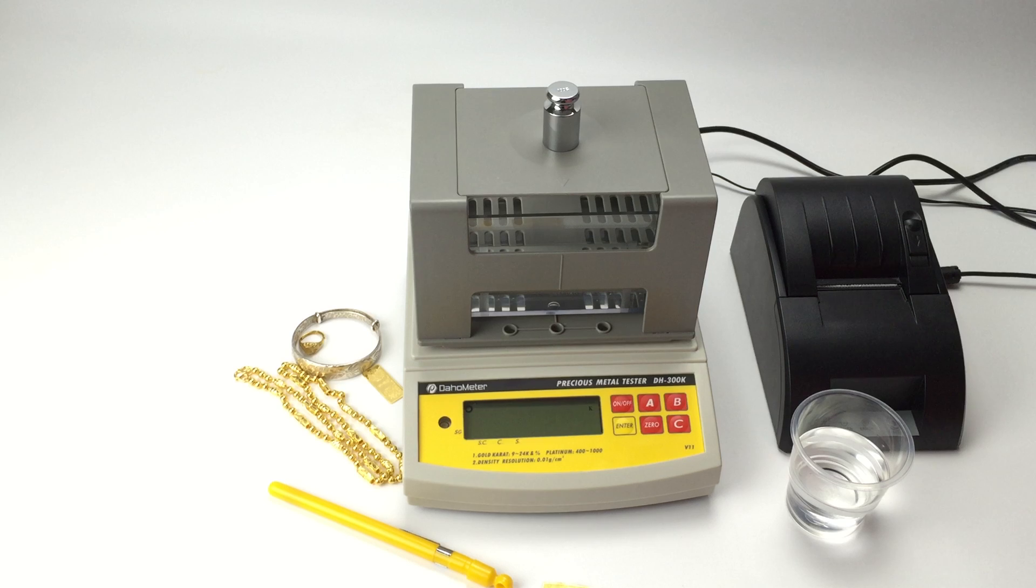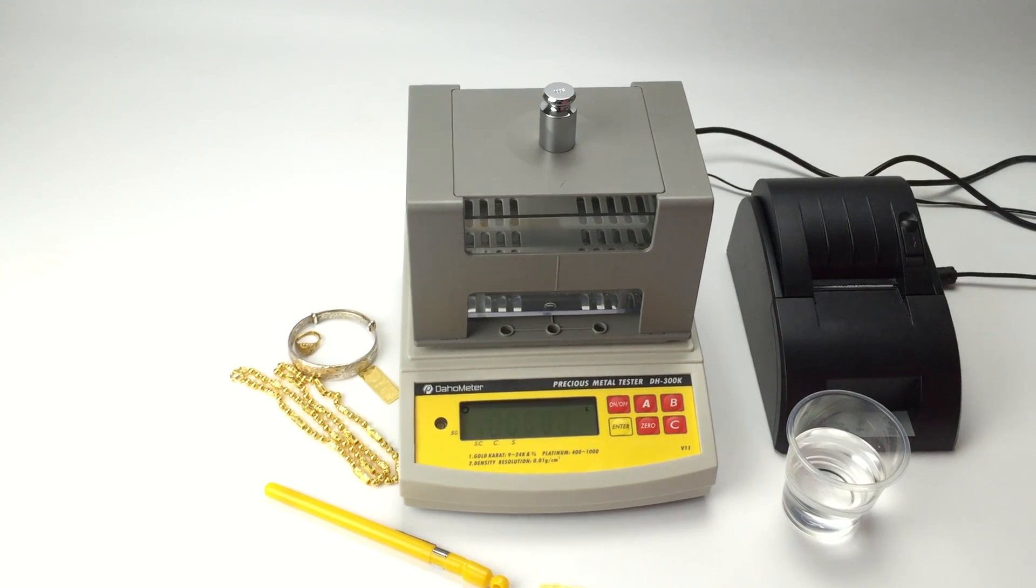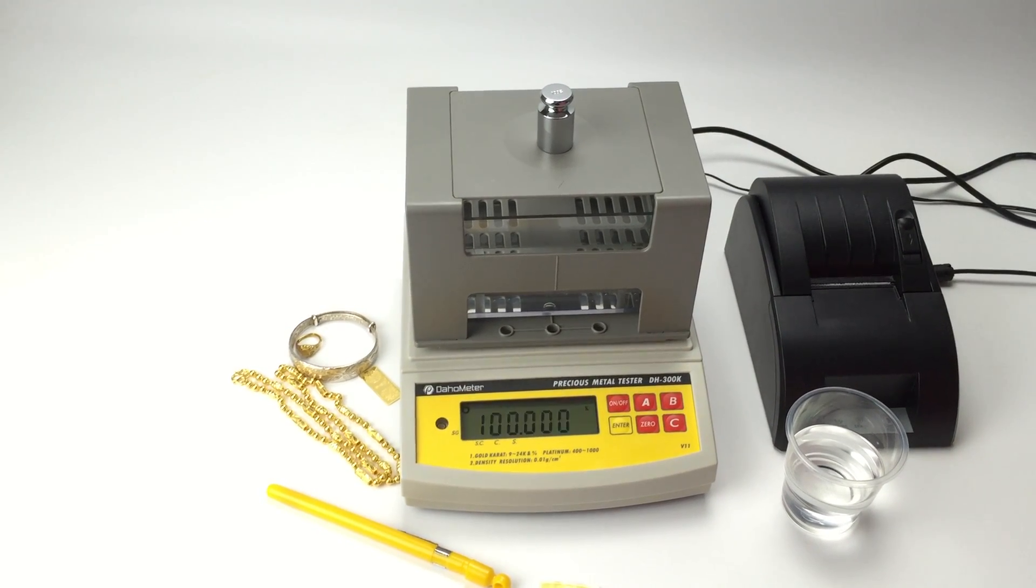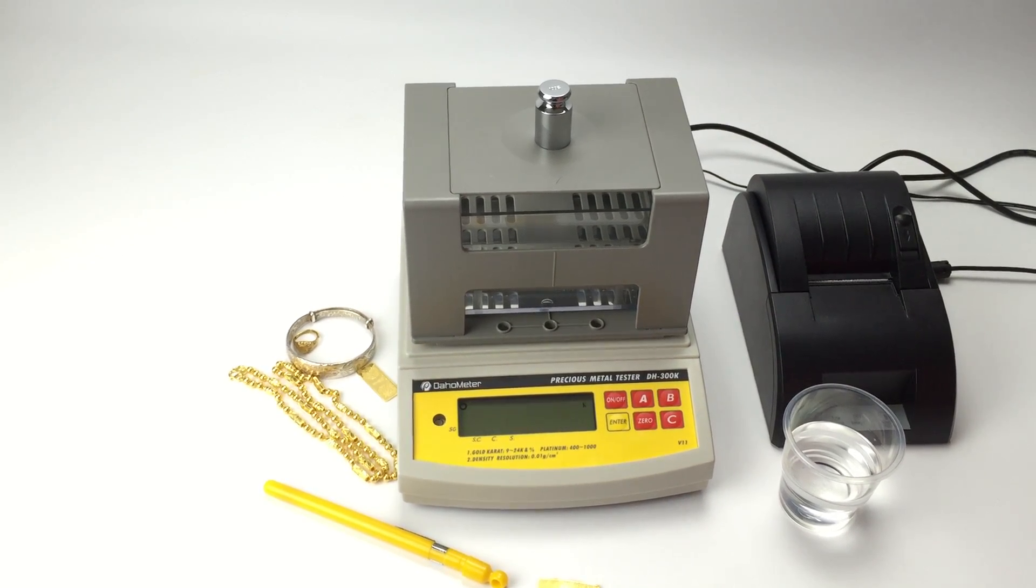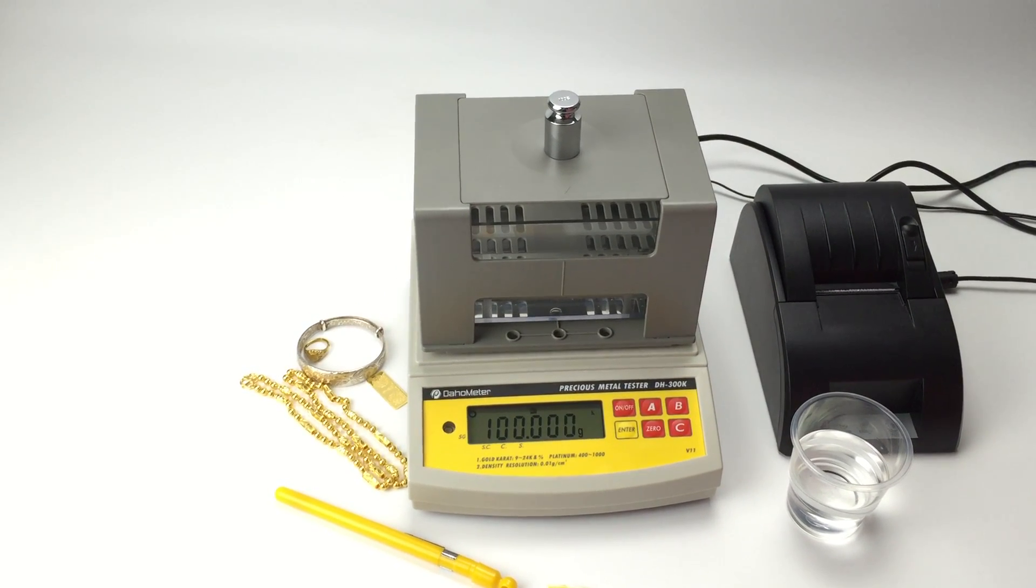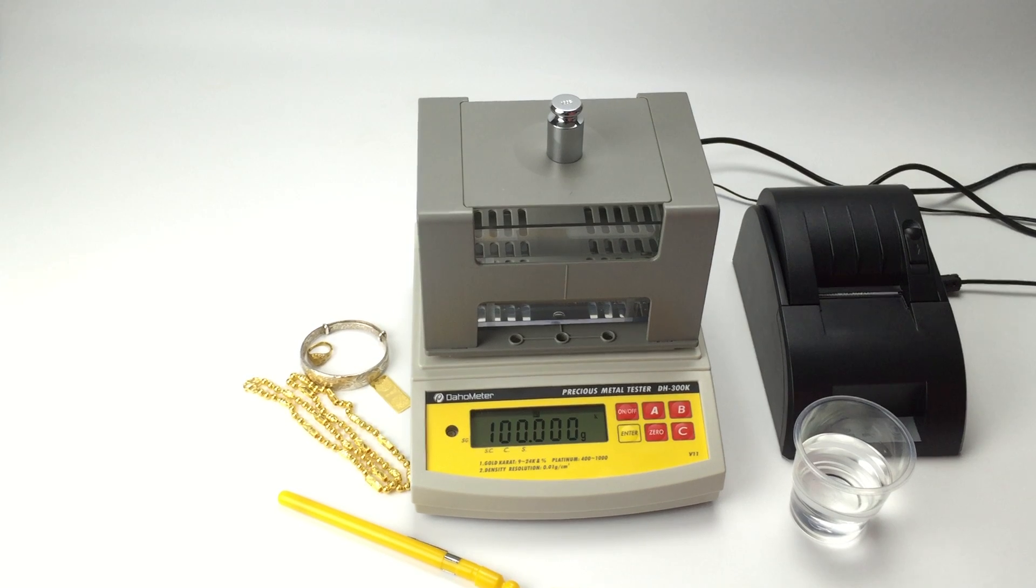The machine will do weight calibration automatically, which means the calibration is done.